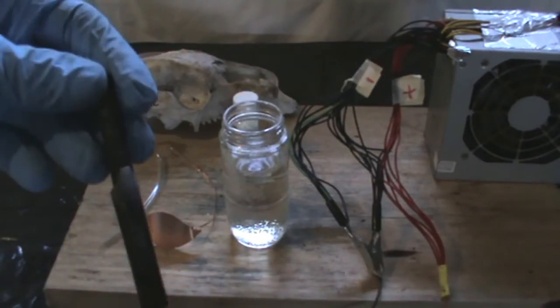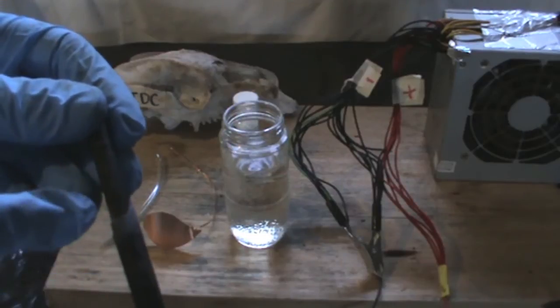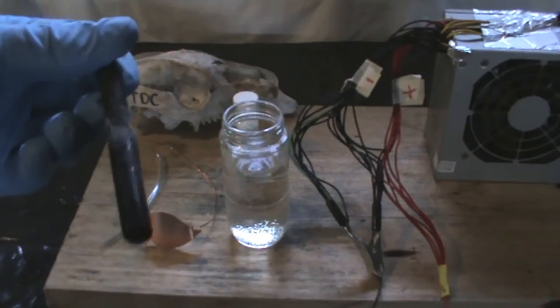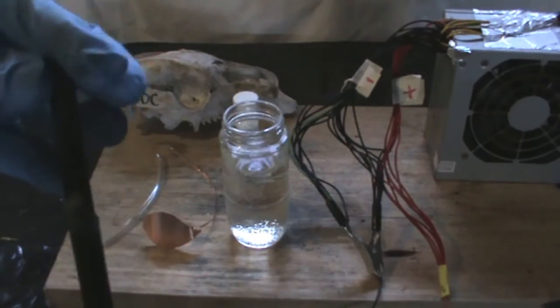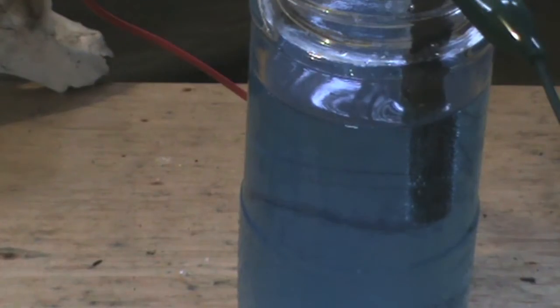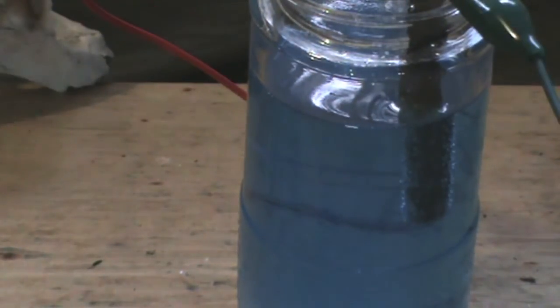As you might be aware from previous videos, a lead dioxide electrode doesn't disintegrate when used, therefore being very durable for electrochemical processes that are very oxidizing in nature.